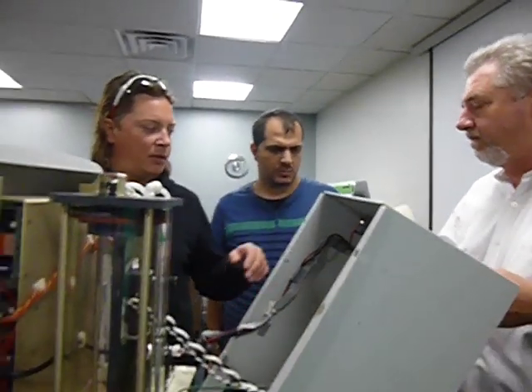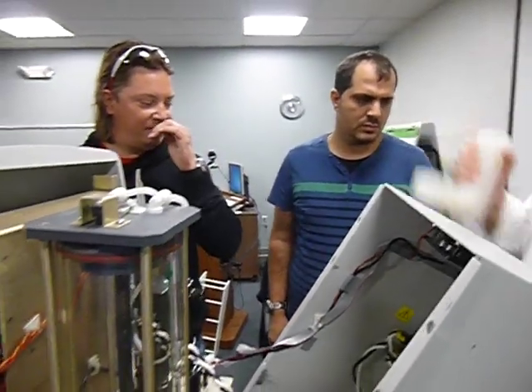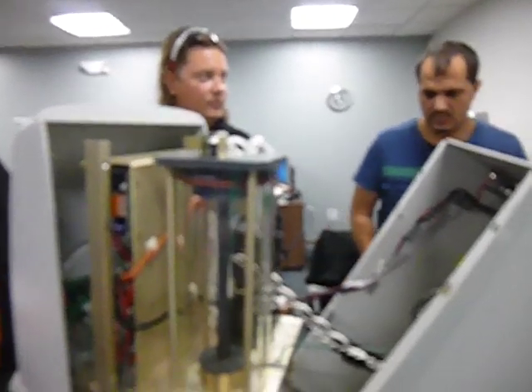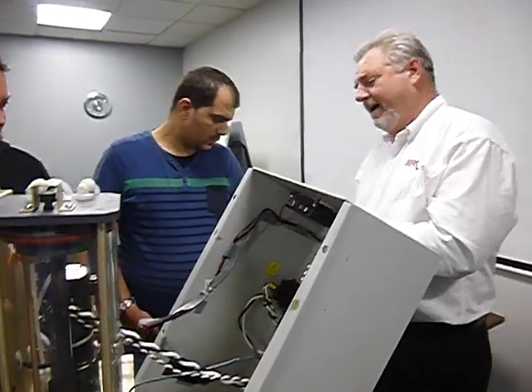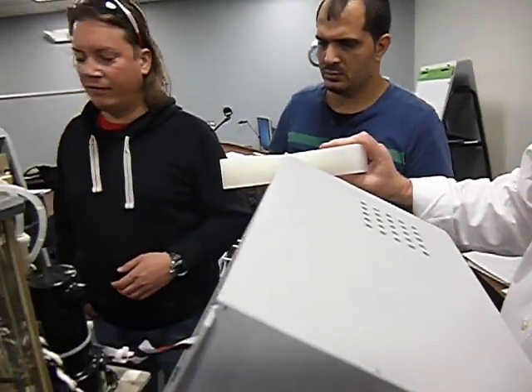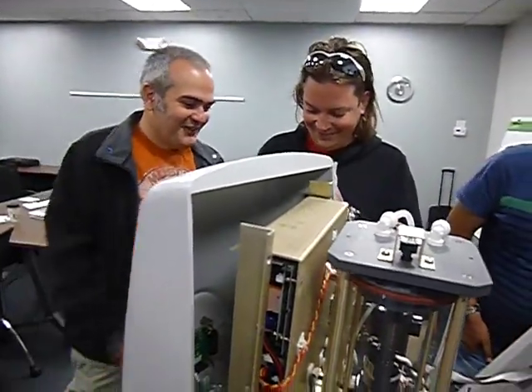We also had a blown up heater block. Well, the old ones were gray. Yeah, that's why they went to these. What happens, they were cracking in high elevation areas. Yeah, it's in the third story. This is from Teflon now. I don't know what exactly. I think it's Teflon, but these I haven't seen break. Boomerang. It's like a killing thing.